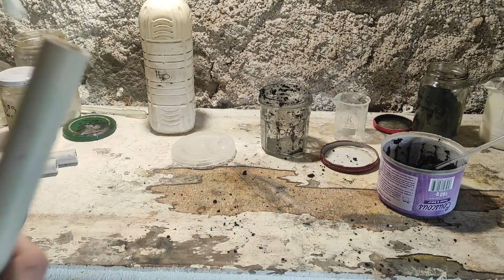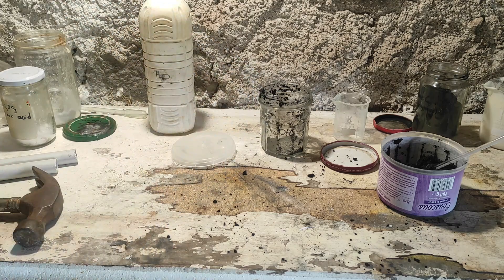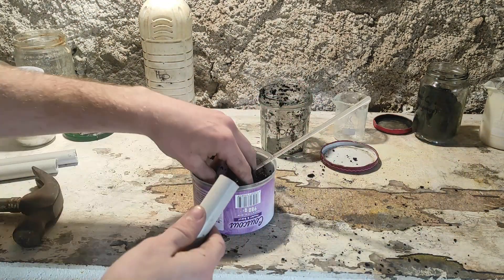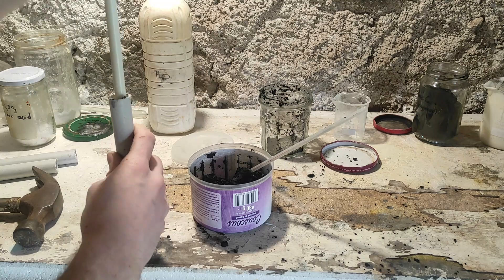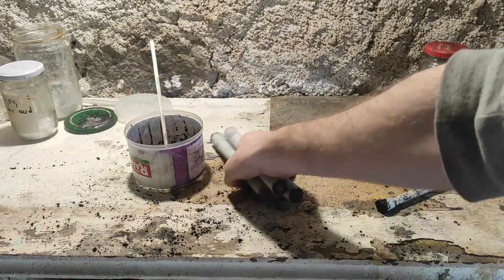I've started to pack the paste into some PVC tubes I've made, using a rod to pack it very tightly to avoid air pockets as much as possible. I made three tubes from PVC pipeline and some corks. Both the corks and the PVC are going to burn in the fire. You can also use other plastics, paper, and maybe metal as well. In the end we have our three electrodes.